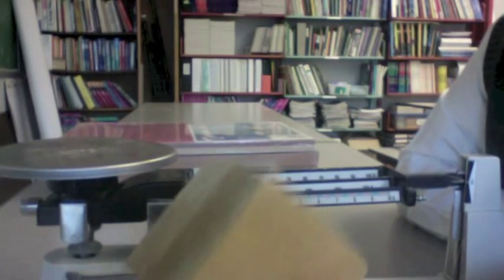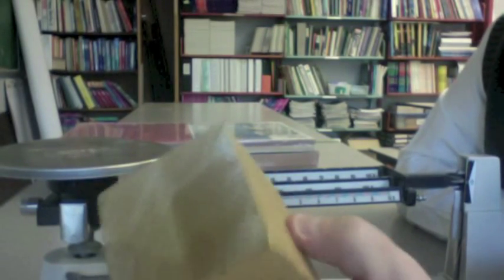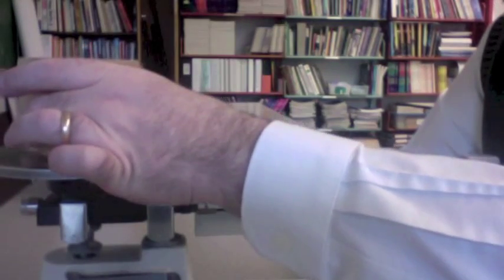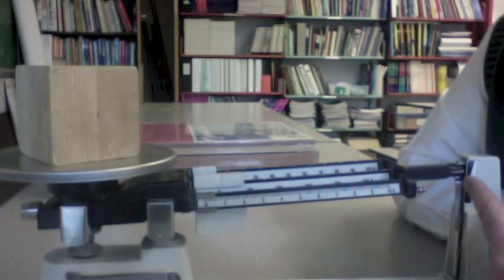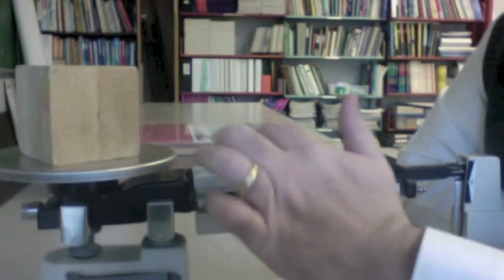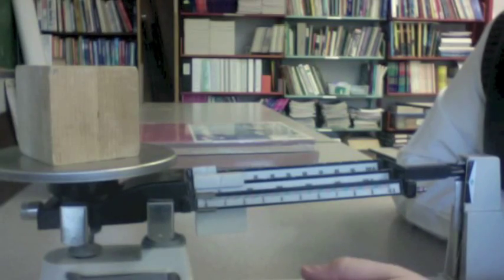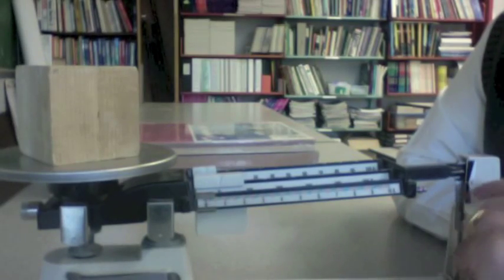Okay, so now that my balance is balanced, I'm going to take the object that I want to know the mass, and I'm going to stick it on the pan. When I do so, we notice that the pointer now is on the up position. Now I need to adjust the sliders to balance this back to zero.